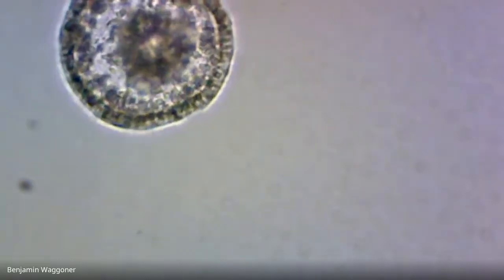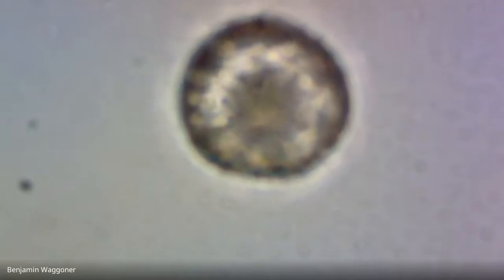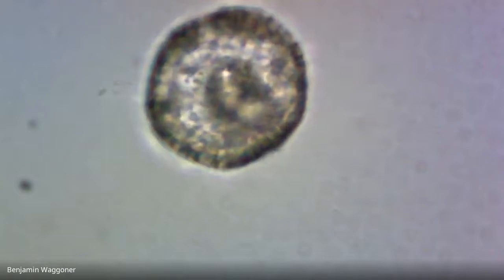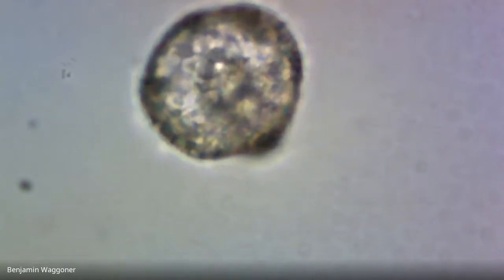It's not easy because what I'm seeing on the screen doesn't perfectly match what I'm seeing in the eyepiece. Trying to keep it centered on the screen while it's moving in two different directions, depending on where I'm looking at it, is kind of mentally weird. But there, okay. All right, that'll have to do.